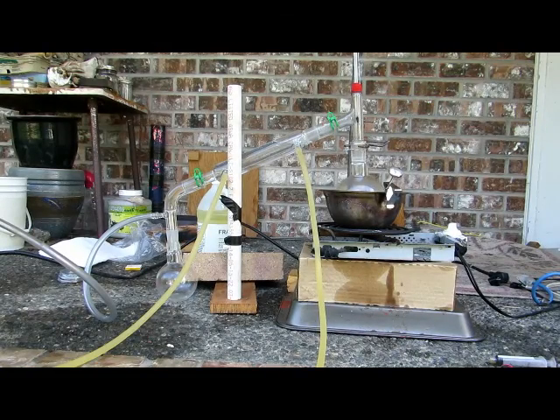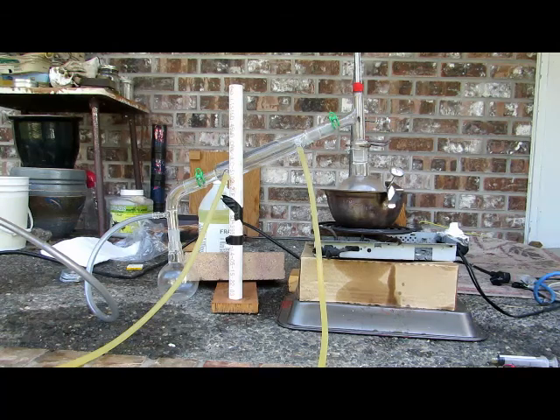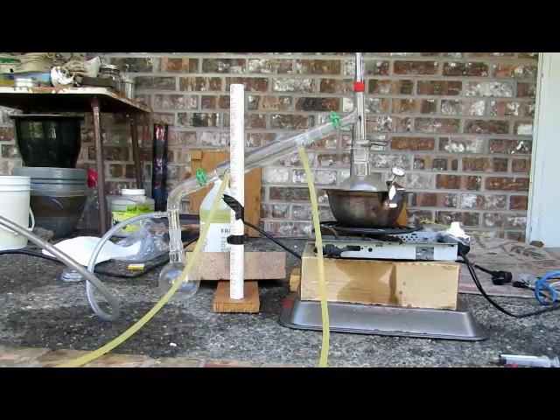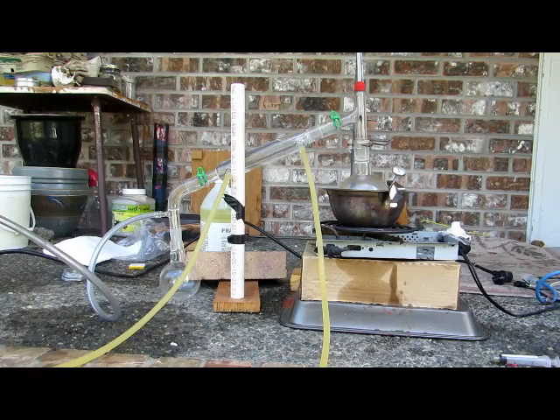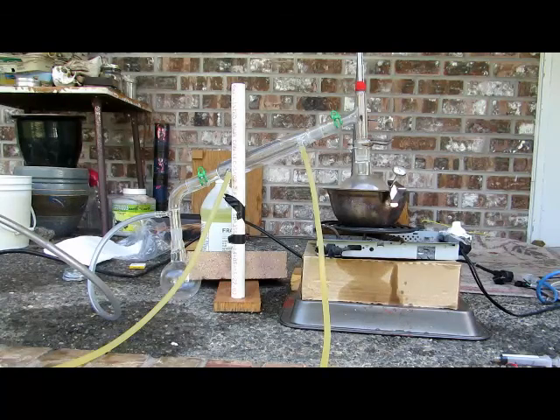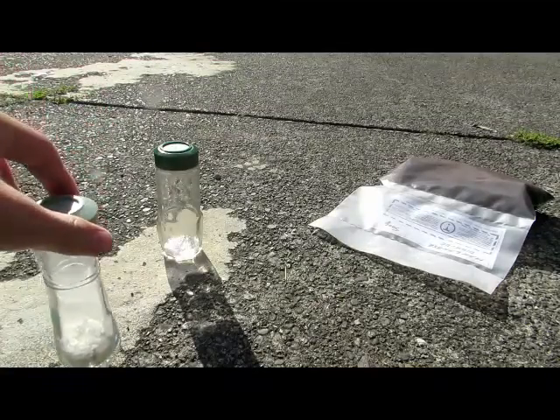It has been exactly one hour. We did collect a fair amount of distillate which came over at just above 20 degrees Celsius and stayed around there mostly the whole time. I'm now going to disassemble the apparatus and turn off the vacuum. Very quickly we must take our lithium peroxide and put it in an airtight container — try to avoid breathing on it, because we exhale a fair amount of carbon dioxide and we do not want to start converting our lithium peroxide into lithium carbonate. Getting it into an airtight container as soon as possible is the number one priority.